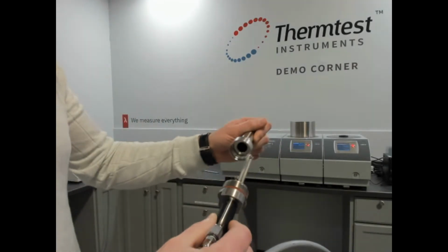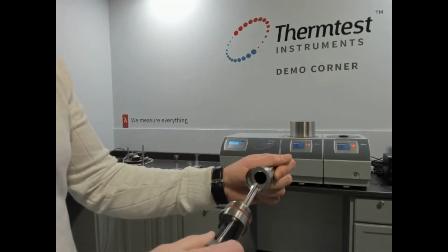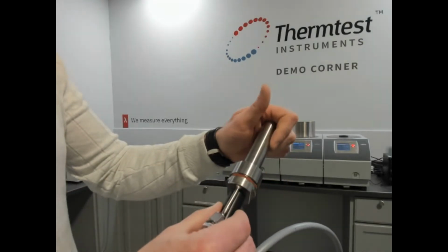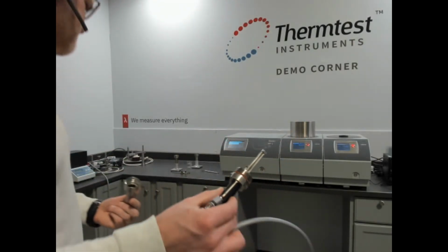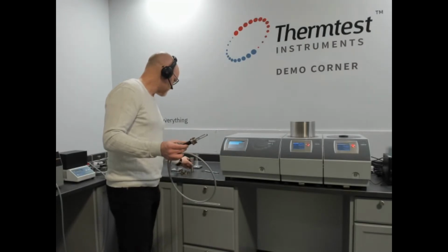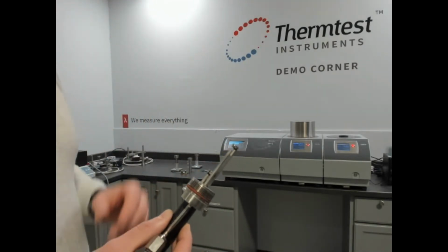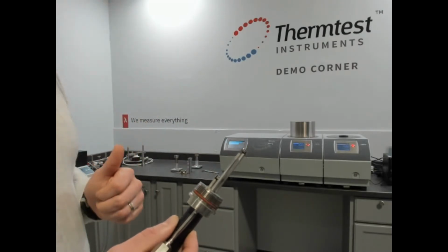This sensor would be inserted into a container with fluid, a cell for fluid with fluid in it, and we'll show you this setup, but that would be your containment. It holds about 20 milliliters. And once a measurement is done, all the measurements for fluids are done at 1 second. Power is selected based off the thermal conductivity of your fluid.